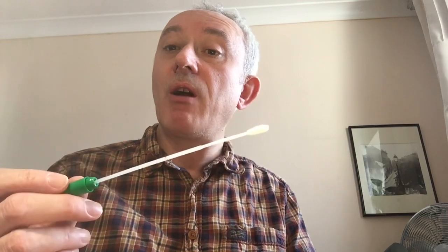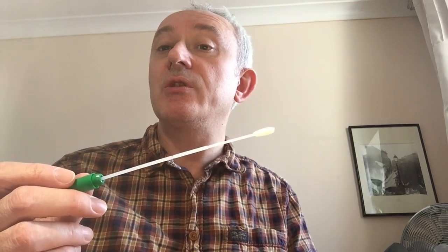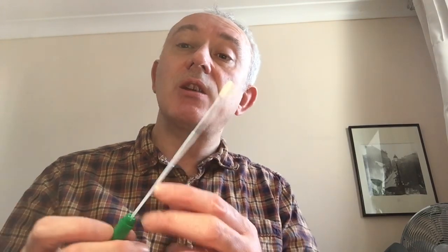It's also important that swabs are sterile when they're used in clean rooms, so there's no risk of additional contamination.